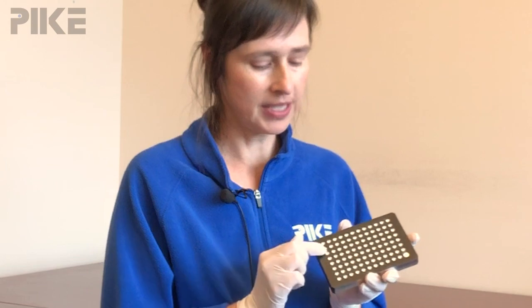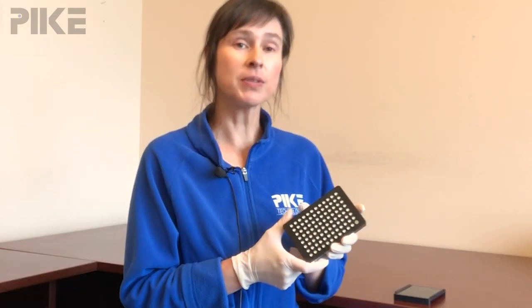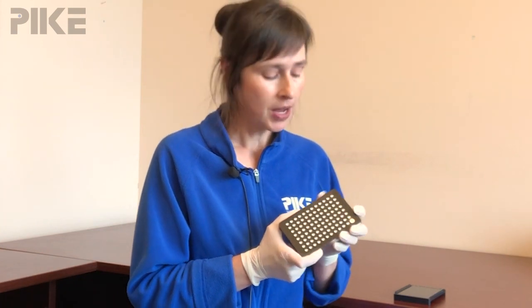The standard plate it comes with is a 96-well diffuse plate, which contains little tiny wells. Typically someone would put a powder in there, but it doesn't necessarily have to be a powder. We've got users putting little gemstones in there.